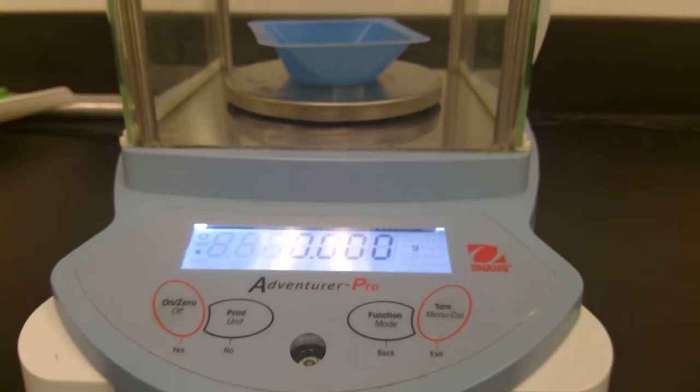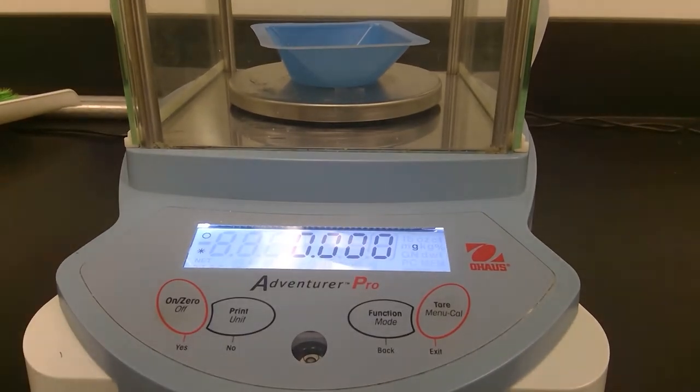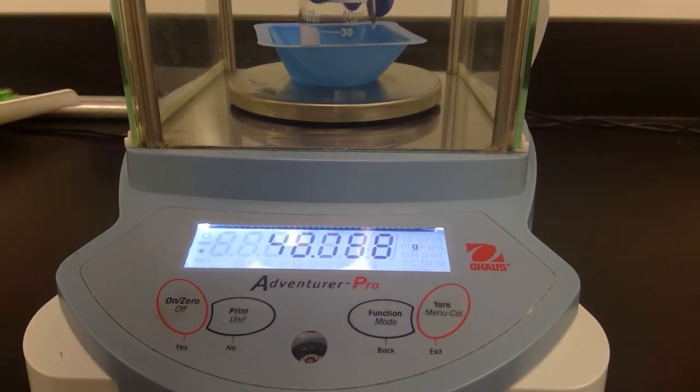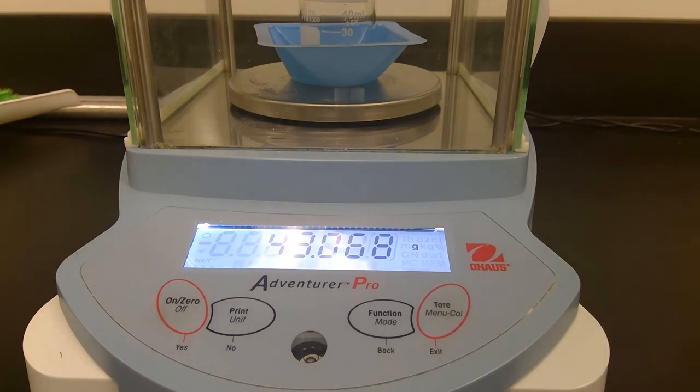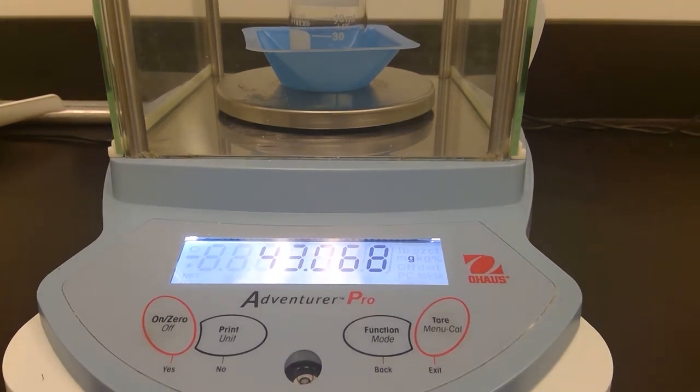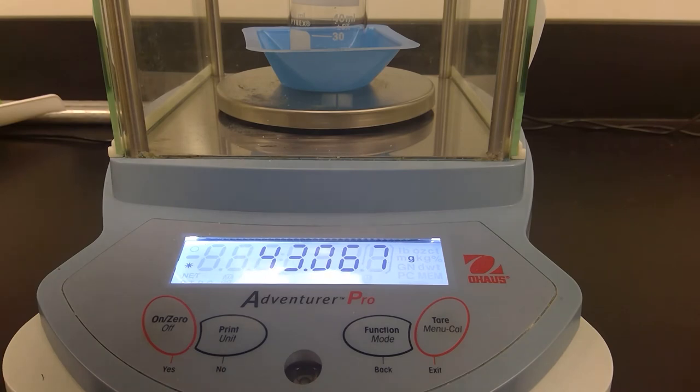Now we'll go and measure the mass of our beaker again. They wanted me to remind you guys, we're only using one of these analytical scales to do all of our measurements so that it's consistent. Record the mass of your beaker.